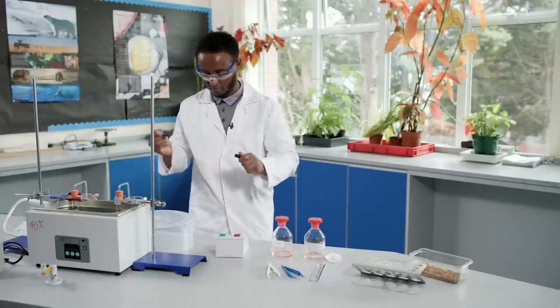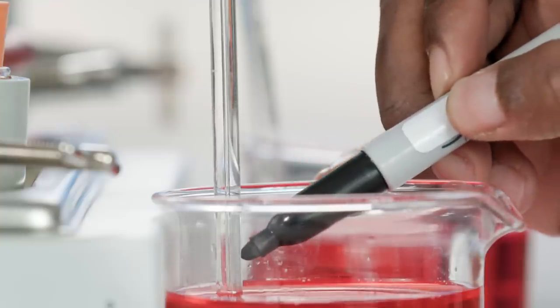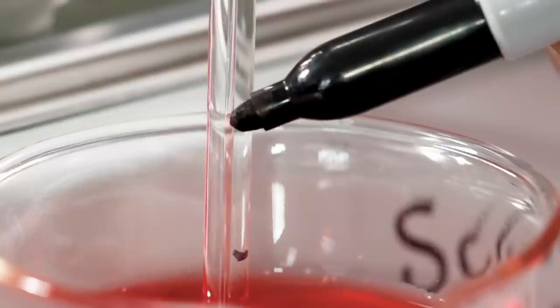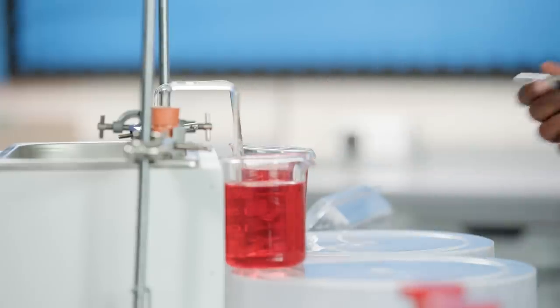Mark the position of the colored liquid in the tubes and time for five minutes. Mark the position of the colored liquid again and measure the distance traveled.